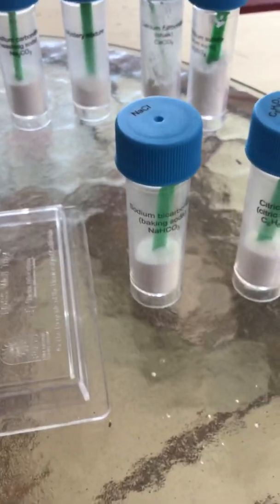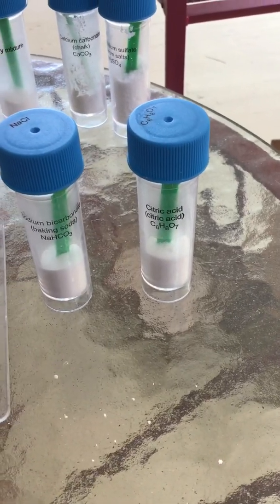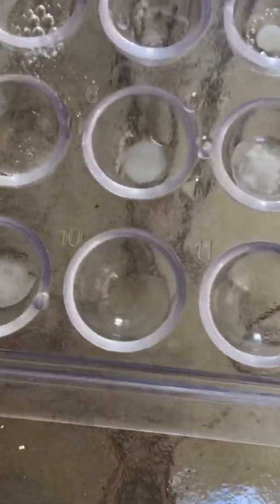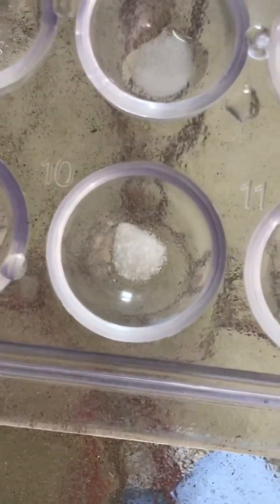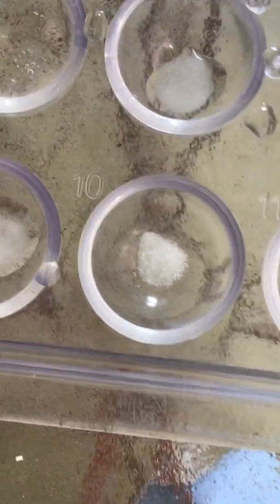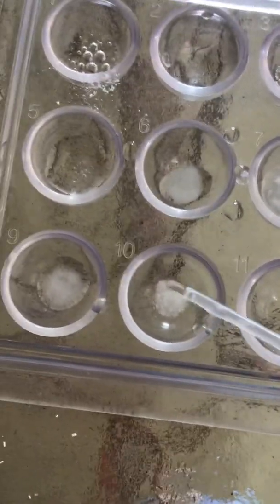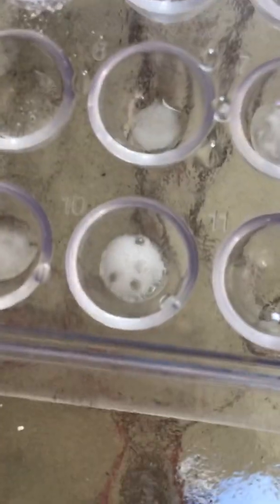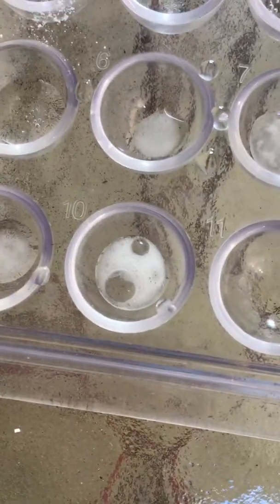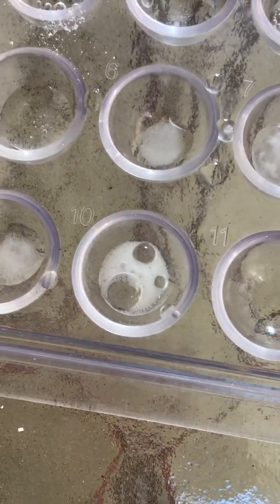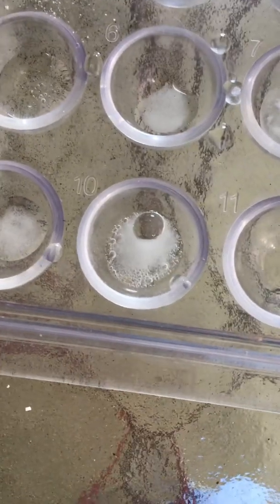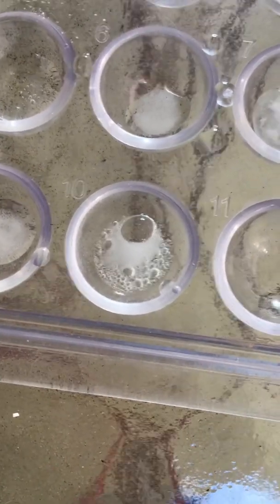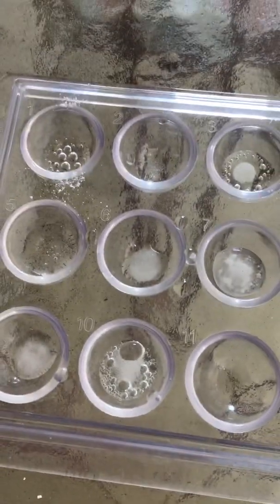Next, I'm going to try sodium bicarbonate and citric acid in well ten. This is what it looks like—baking soda and citric acid. What happens when I add water? Wow. That still seems like way too much, but that's the most rapid fizzing I've seen yet. It's really cool. Very close. It still reminds me of three more so than one.